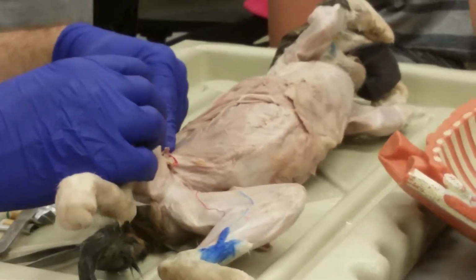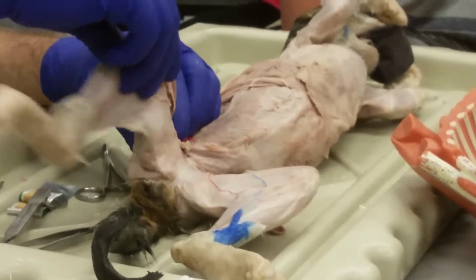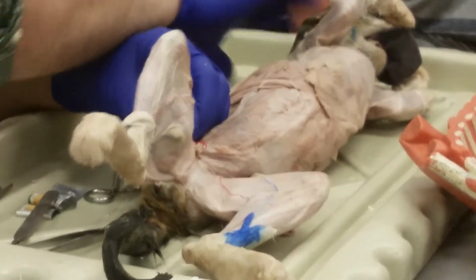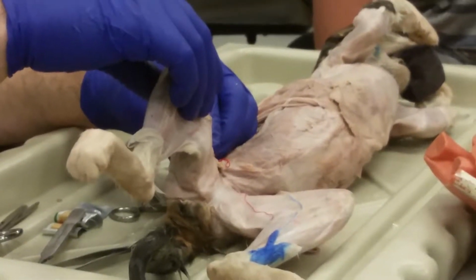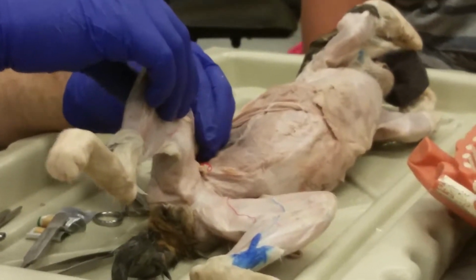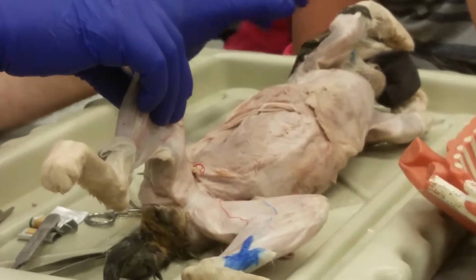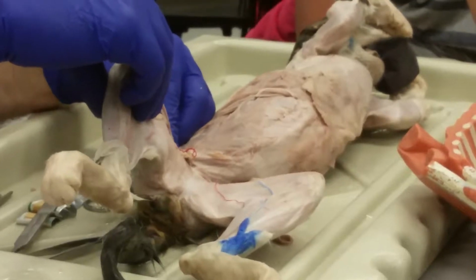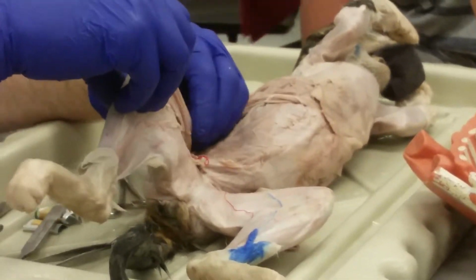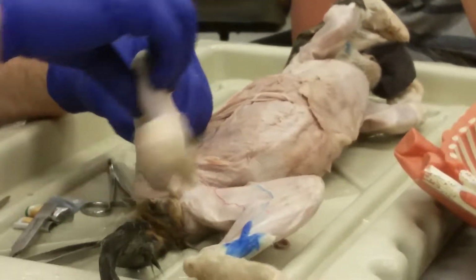Now, one more thing it does. Normally we don't pay attention to rotations of these ball and socket joints unless for the rotator cuff. Any muscle that pulls on a ball and socket joint is going to do some sort of rotation, and I don't ask you to know most of those except for the rotator cuff. But here, I think it's a good one because it pulls from lateral to medial. So it's pulling the medial over to the lateral, so it laterally rotates.